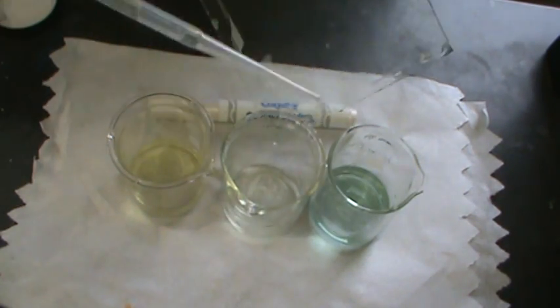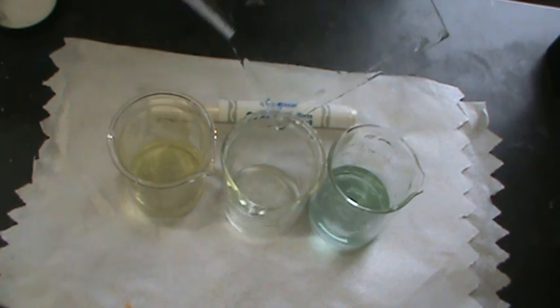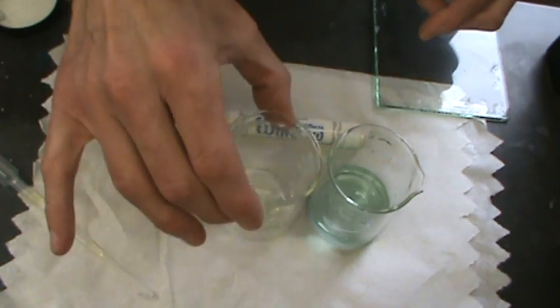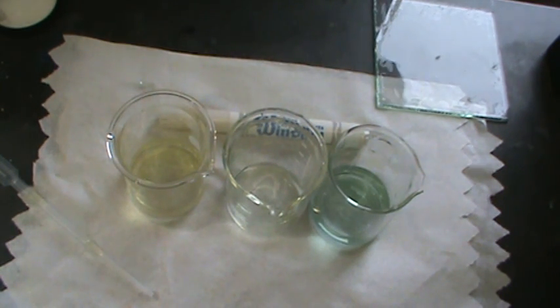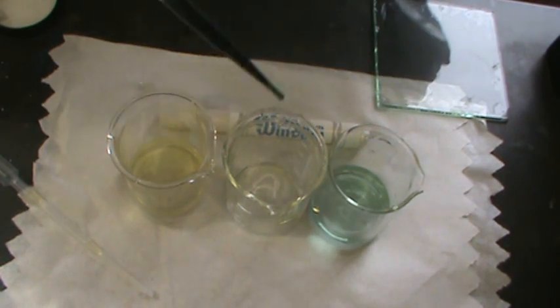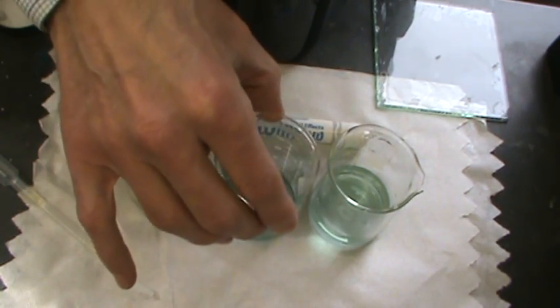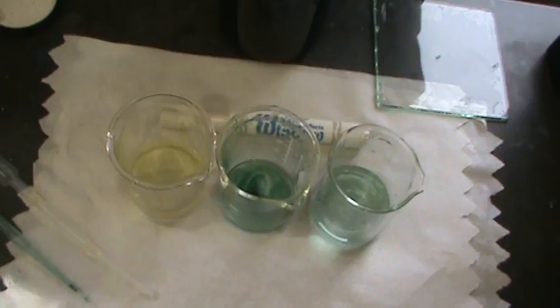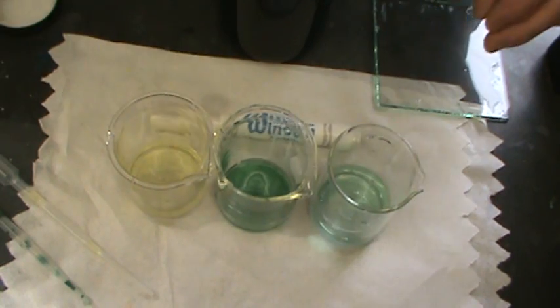Alright, I think there's a little more on this pane. I'm going to try to get it in. There we go. So now what I've done is I've collected the residue from the crystal marker into this center beaker. And now, it's hard to see the color now because it's been diluted, so I'm going to go ahead and add some bromothymol blue indicator to this center beaker. And sure enough, we note that the color has changed to a bluish-green color, indicating the presence of a weak base in the crystal effects marker.